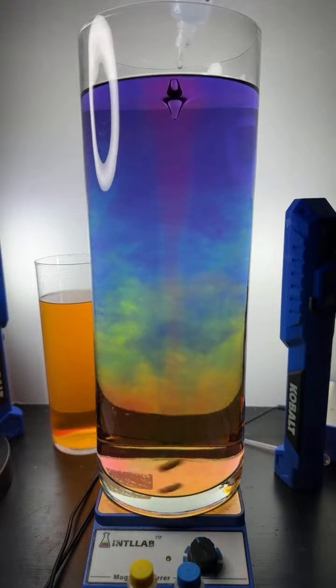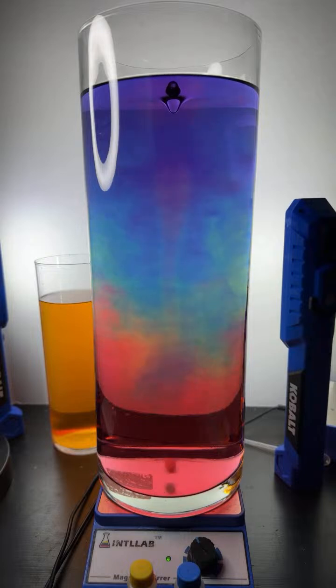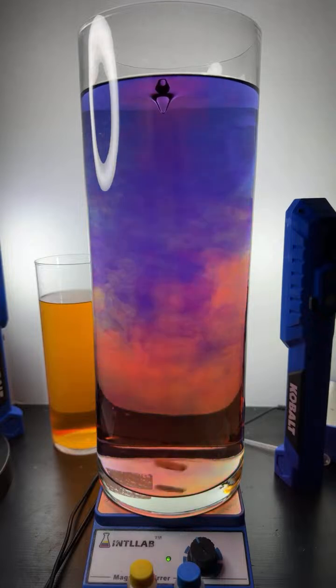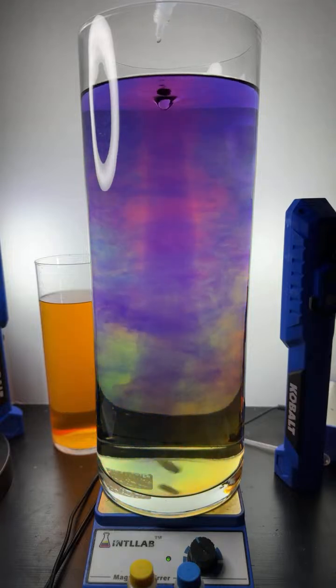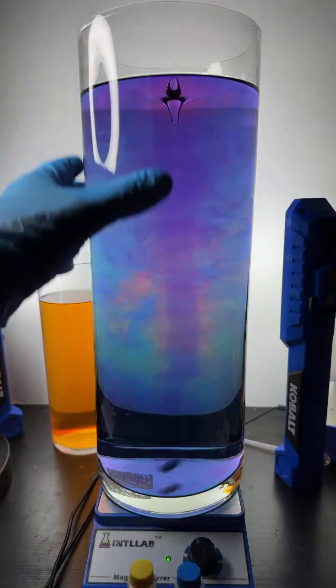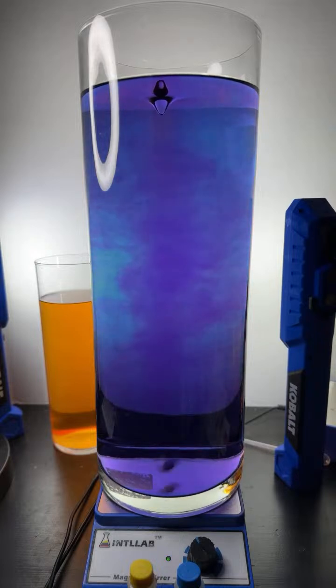We're going to keep these colors going here. Yeah, if you're new to the live and you haven't seen this before, gosh, look at those gorgeous colors. What we're doing is a really simple science experiment. I just add some universal indicator to a big flask of water. This is about a quart size here. So you can see this is roughly 1.5 gallons. It's huge. And to that water, I add some universal indicator.